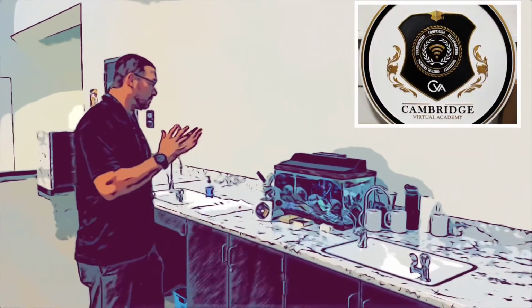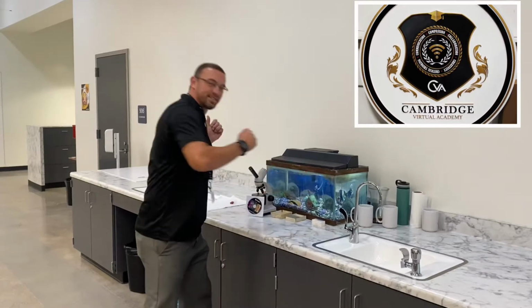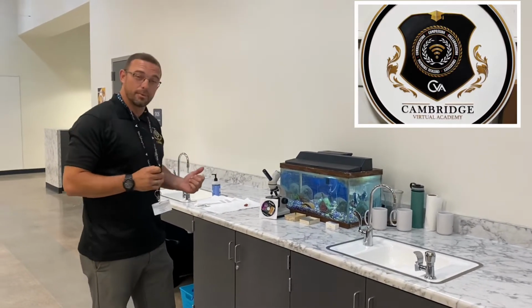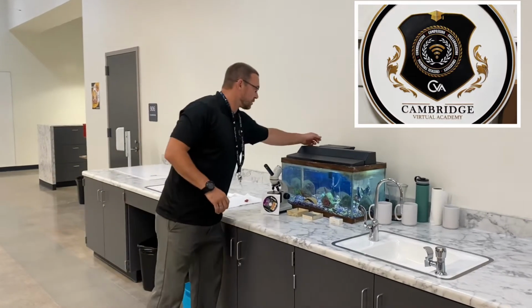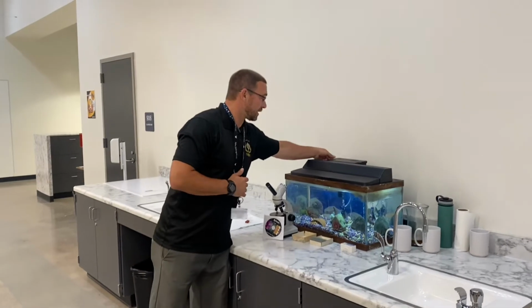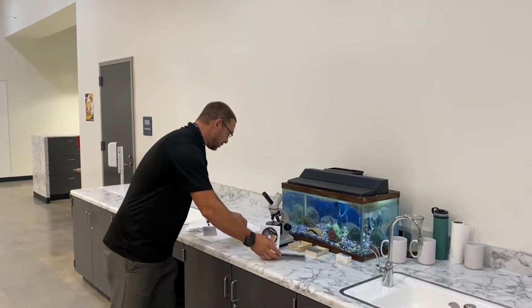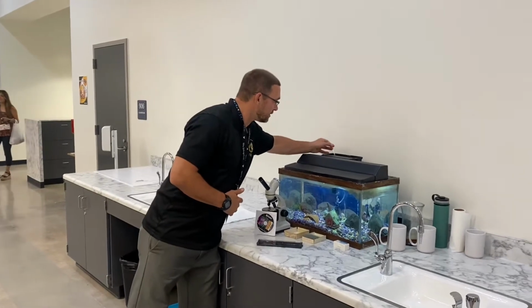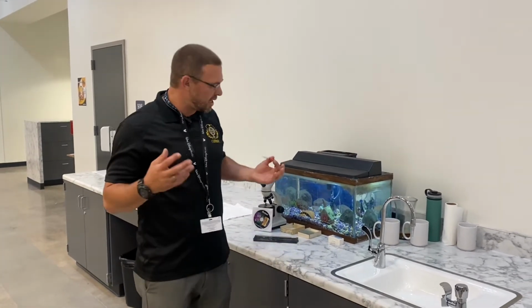So we're going to be using and leveraging the CVA fish tank. What you want to do is to make sure to grab a really good live sample. You're going to be able to go back here, and by the way, everything will be in this general space, but you're going to want to go back here to the filter. Make sure you go to the dry station and grab your pipette. Right in the back in the filter, make sure you grab a good amount of gunk.